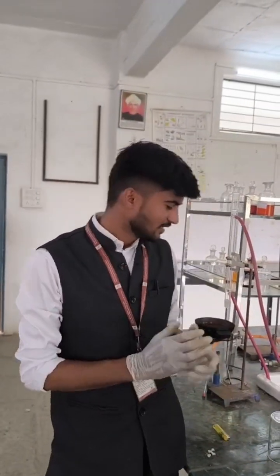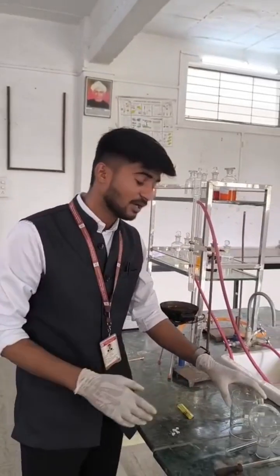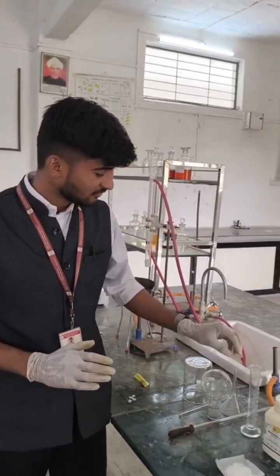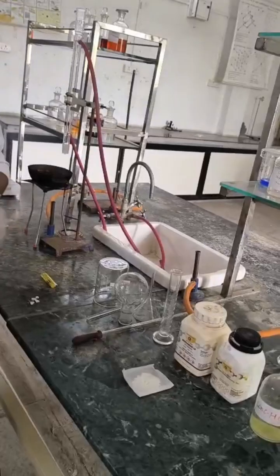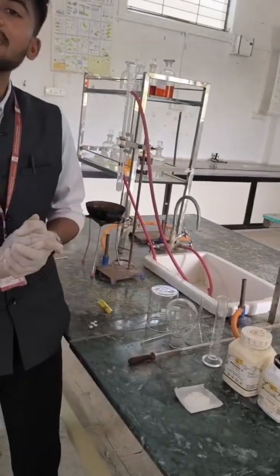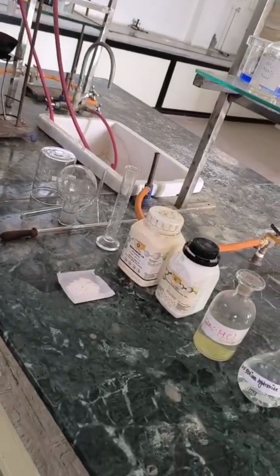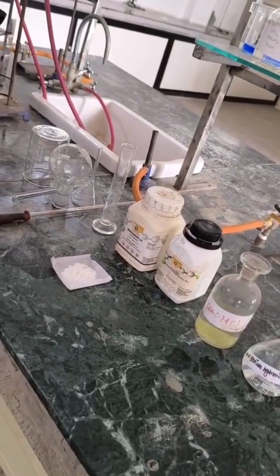For the preparation we require certain glassware and chemicals. The glassware required includes a beaker, round bottom flask, stirrer, funnel, pipette, and measuring cylinder. The chemicals required are benzamide, 10% solution of sodium hydroxide, and concentrated hydrochloric acid.